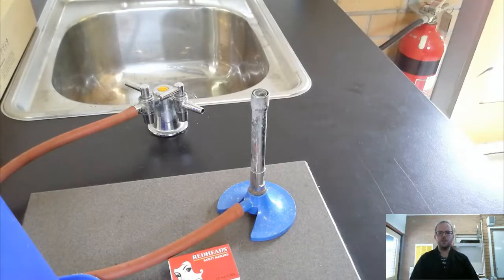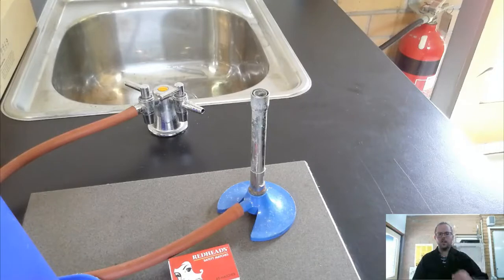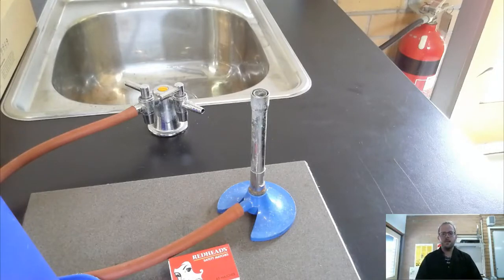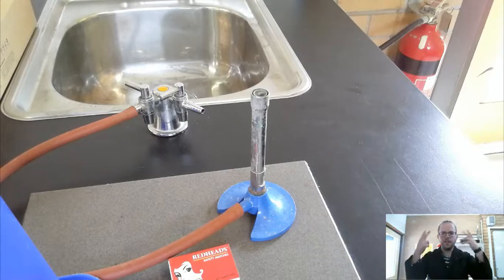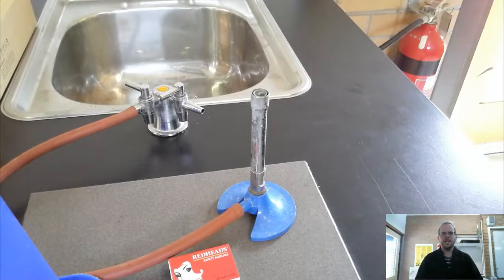There's some of the personal protective things that I'll be using. Obviously I don't particularly need to worry about tying my hair back, but if you are someone that has long hair, then you need to make sure that that is tied back effectively so there can't be any loose strands or anything that might hang down over your face, because we're going to be dealing with a nice big flame here and we don't want to take any chances.